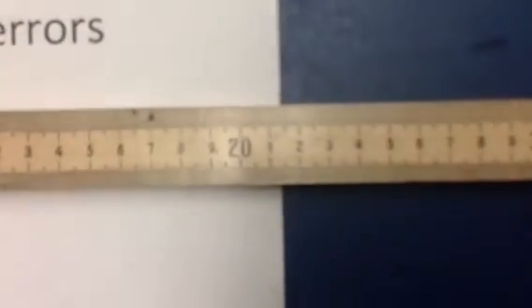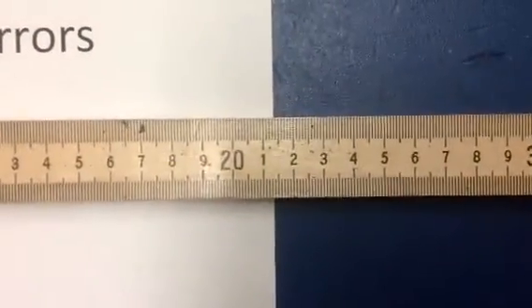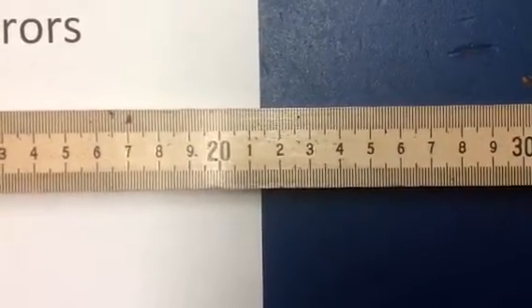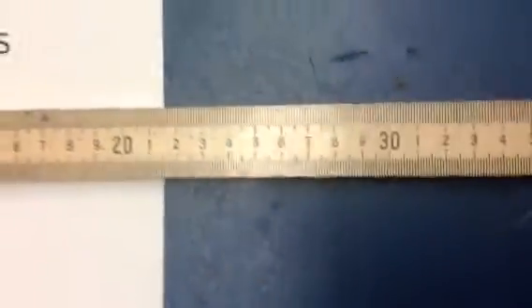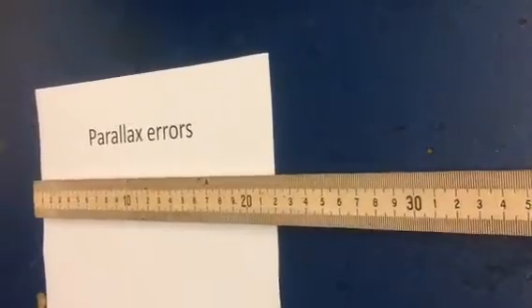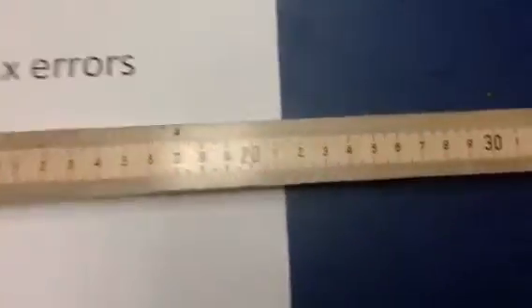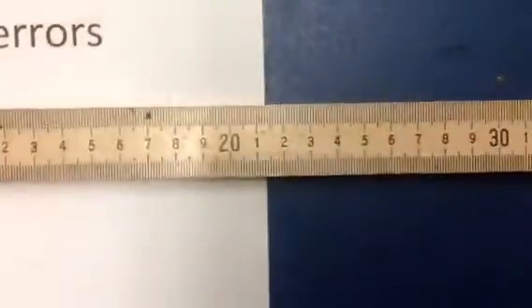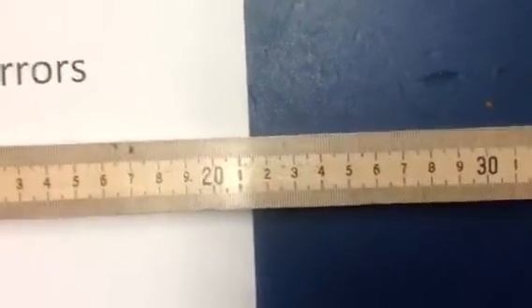Now, if I was to look at, say, this here, first of all, I can look at it straight and level. If I look at it straight and level, what I find is it looks like I've got about 21.38 centimeters. But the problem is if I go over here and look at it, now it's like, oh, look at it. Over here, I'm already up to 22 centimeters. And if I look at it from over here, it's down to about 20.5. So as always, the answer is to look at it from above, from straight and level.